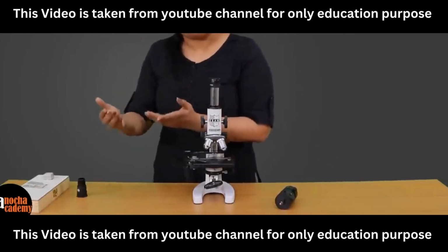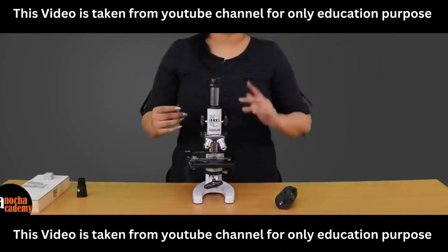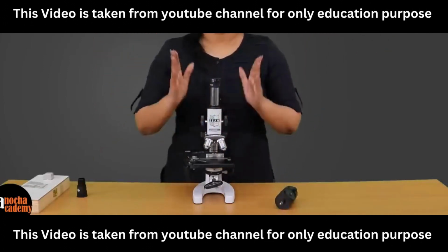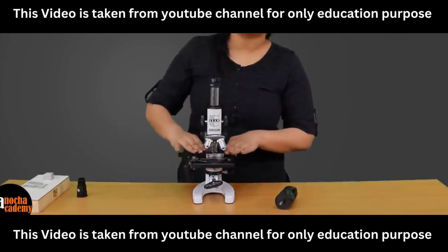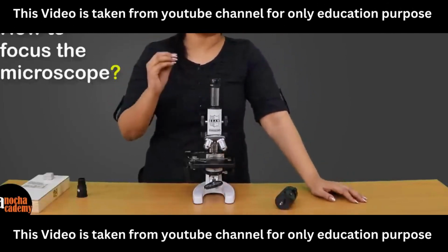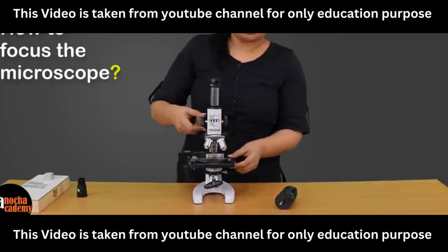After focusing on the object which is near you, you can focus on another object which is further away, but you have to bring that object into the focus of the camera. So similarly here, whenever you are putting a specimen on the stage, you have to adjust so that the specimen is at the focus. All right. So how do we do that?